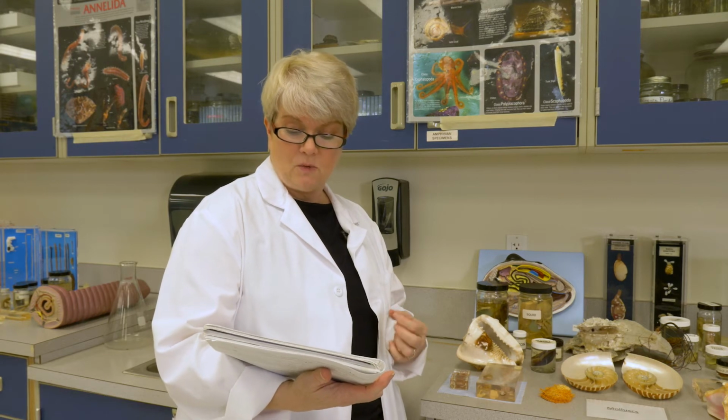The organs that you're going to see are normally a circulatory system, heart and gills. You have arteries, you have a nervous system, you have a nerve ring and nerve cords. An excretory system, you will actually have some nephridia that will remove waste from hemolymph. It's not technically blood, it's more like a mixture of blood and lymphatic fluid.